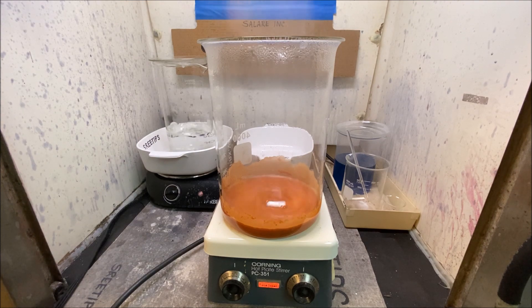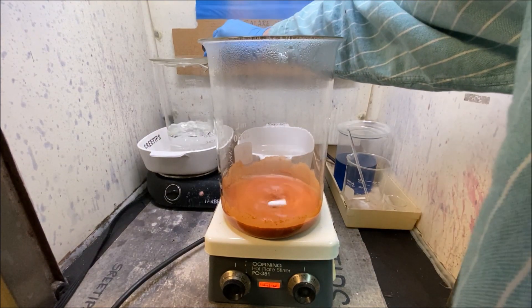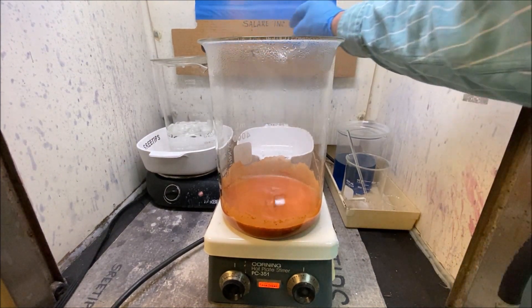I'm going to be doing it backwards. Instead of pouring the precious metals into the formic acid, I'm going to be pouring the formic acid into the precious metals.